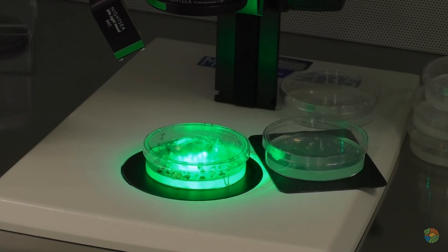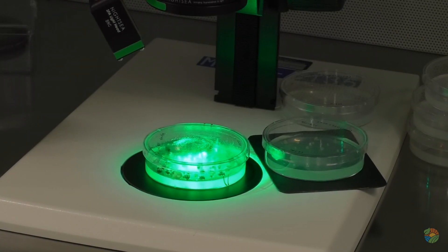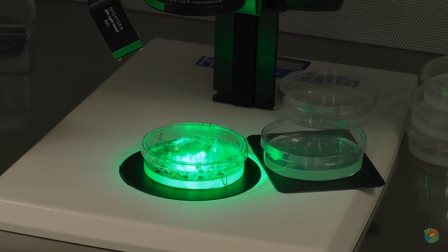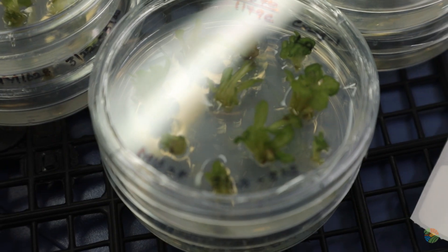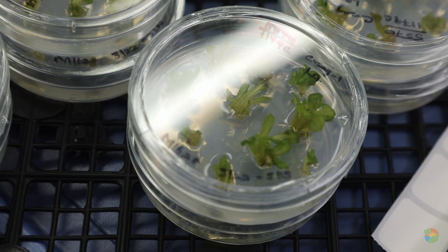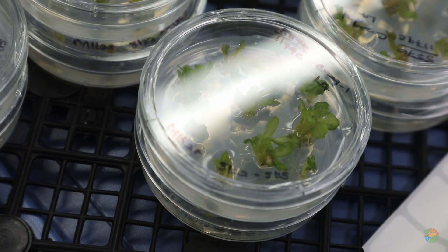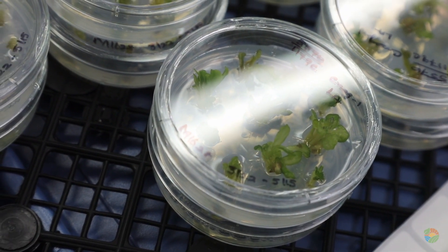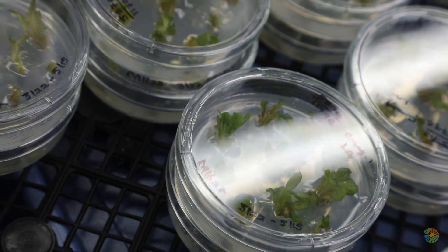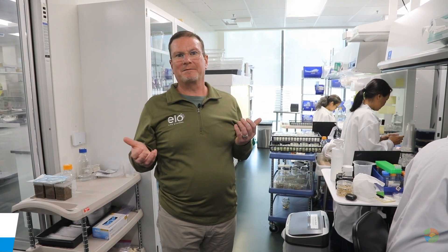What you see going on here is the next step of our process, where we've identified the genes that we need to make some edits in. Now we want to get them into plants, and so our team here in this area is working on bringing the genes into the cells and then growing the cells back into plants.